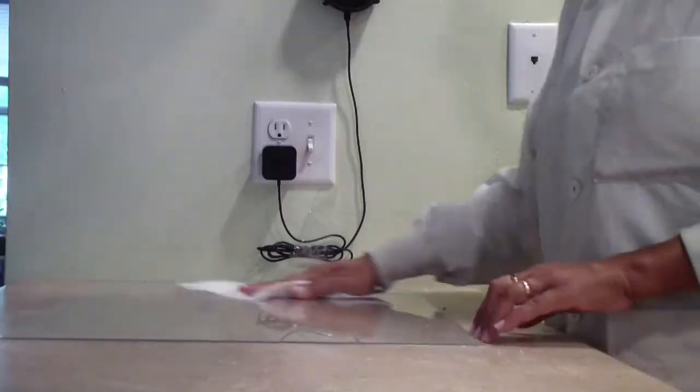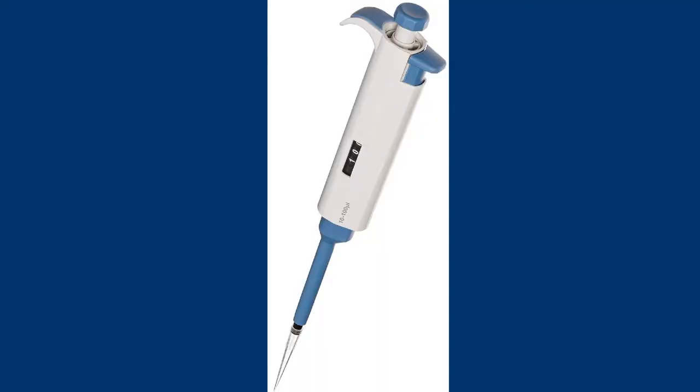Wash your hands. Wipe your bench. Before you use the pipette for the first time, you should practice a bit without a tip or liquids just to get a feel for the instrument.